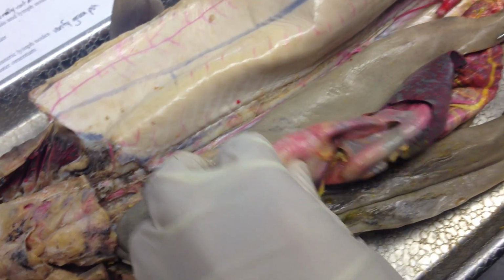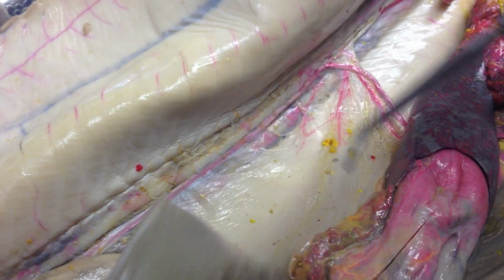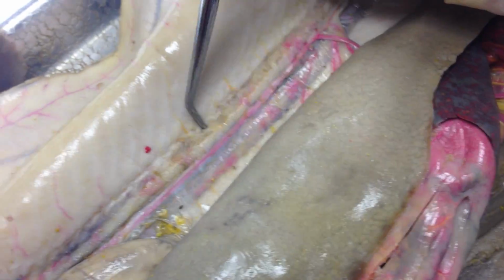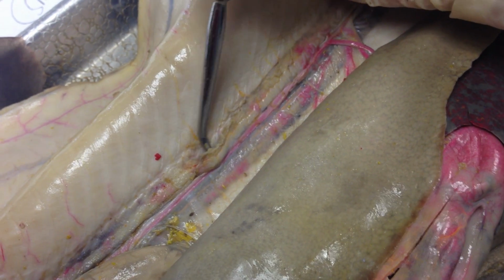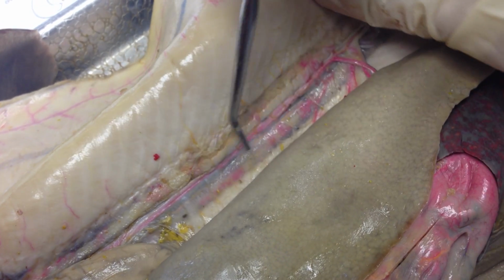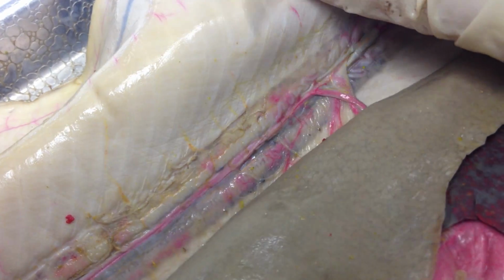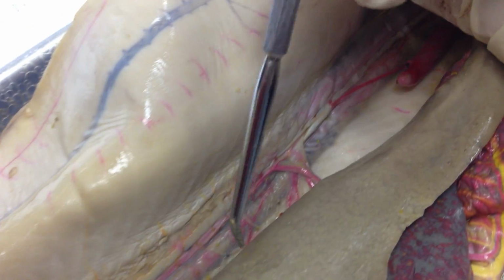The kidneys are not like kidneys in mammals, so it's actually, if you can see this, that's the kidney, and it's called an opisthonephric kidney. And the archinephric duct, which is only in males, is this squiggly white going down from the kidneys, and that's carrying sperm basically in males.